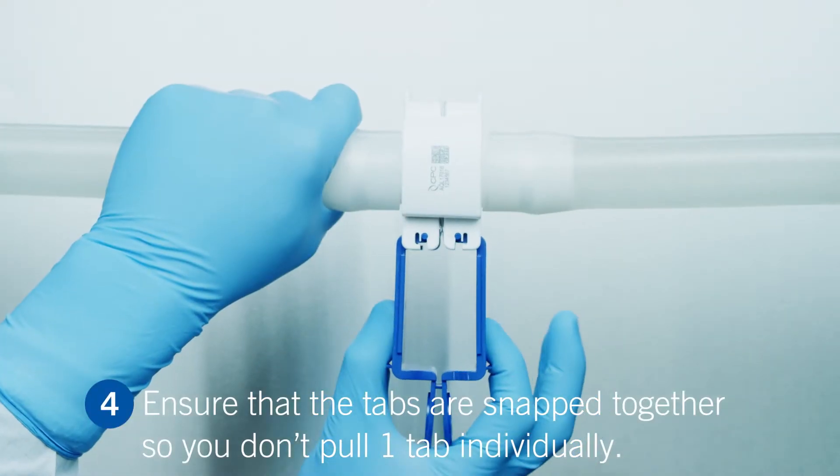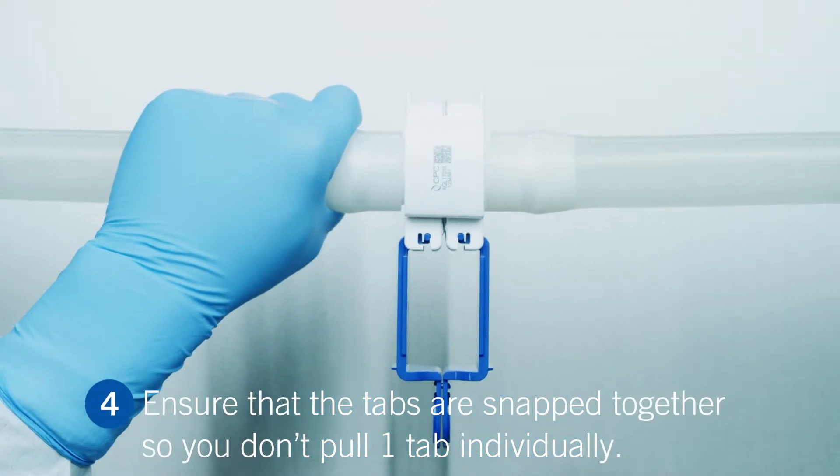Ensure that the tabs are snapped together to eliminate the risk of accidentally pulling one tab individually.